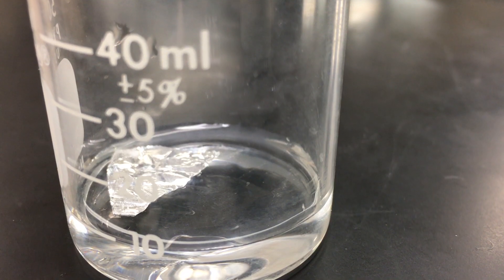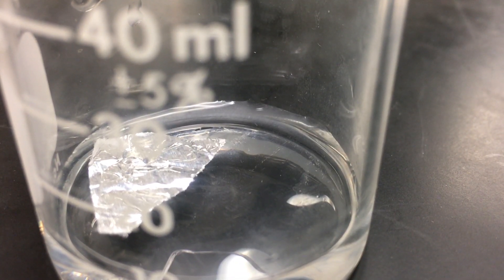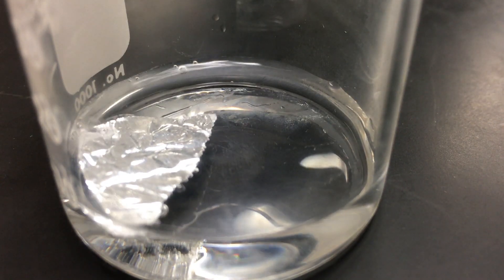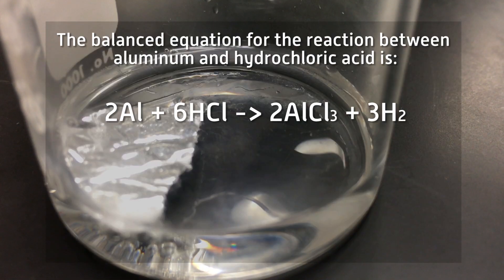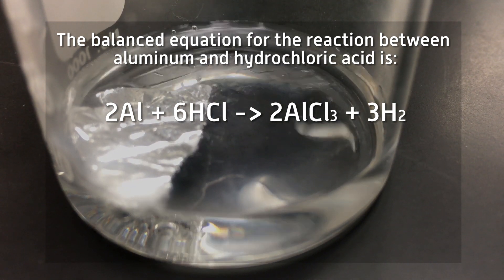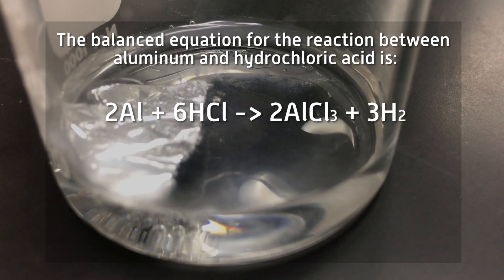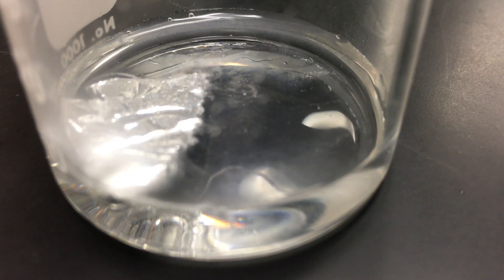Can you all see the aluminum now? Yes. So we're going to see the production of gas. What gas is being produced? Hydrogen. Because the aluminum is kicking the hydrogen off, and so we ended up with aluminum chloride.